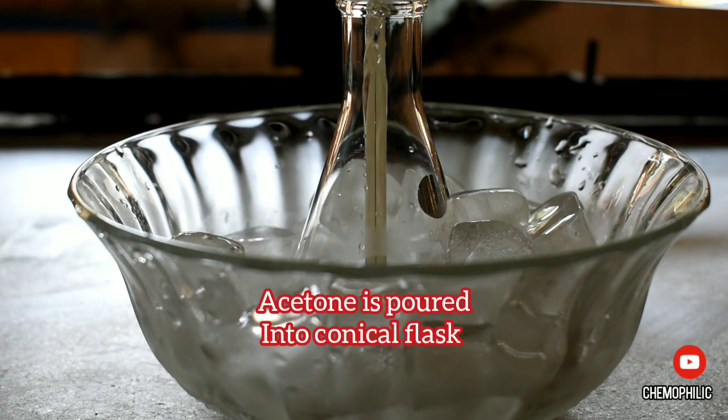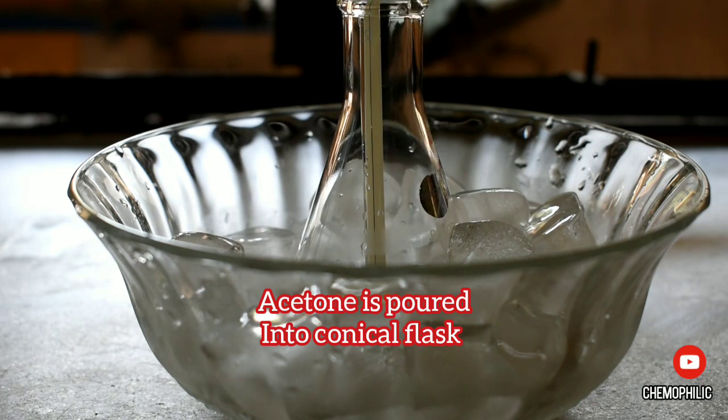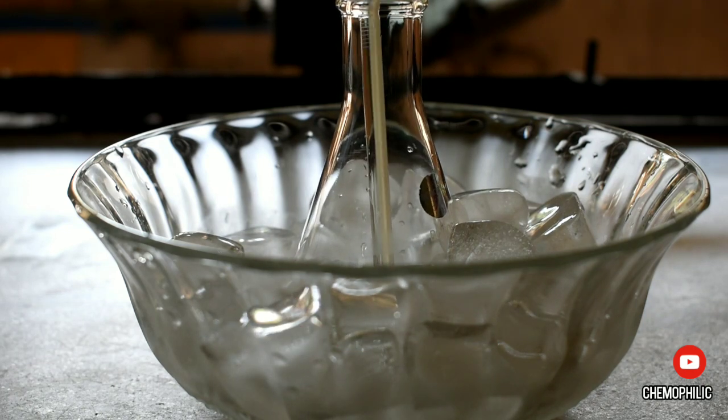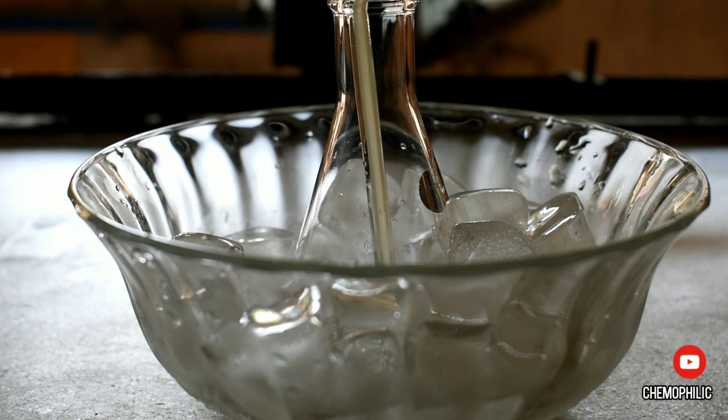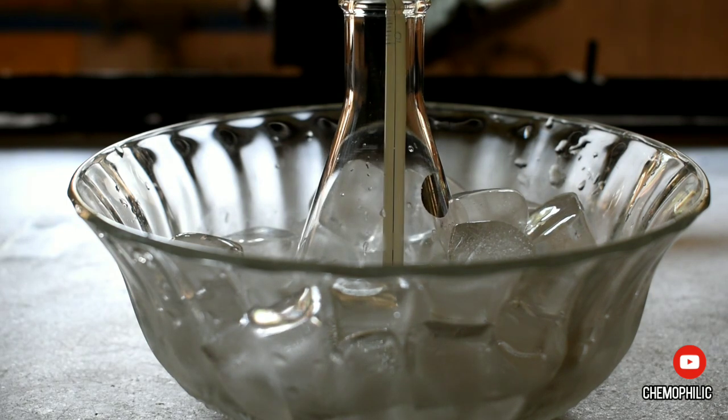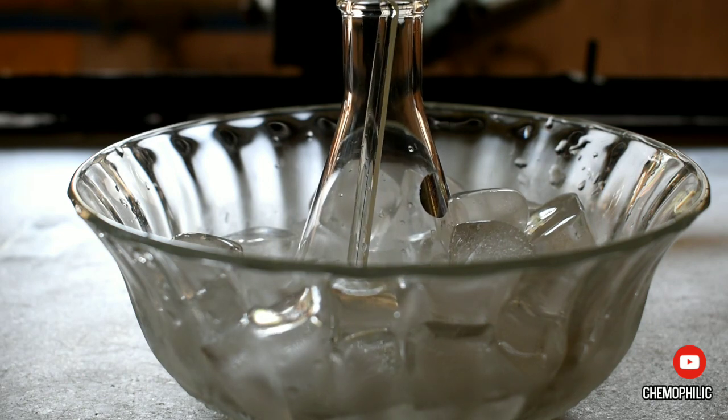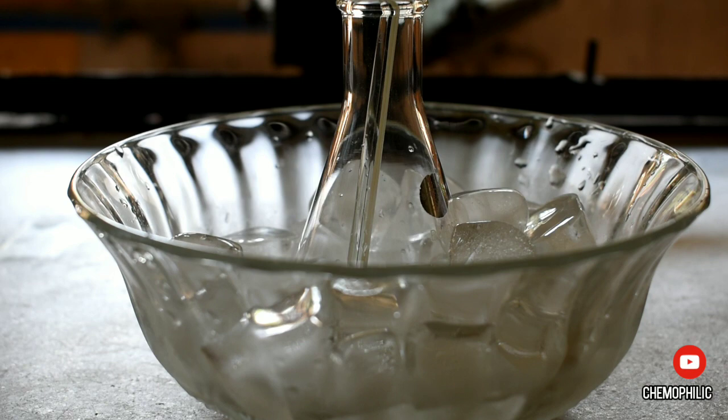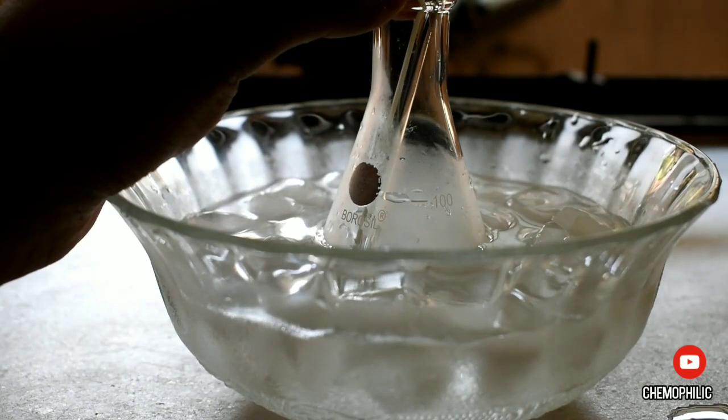Then I poured the acetone into my conical flask and waited for the temperature to fall down around 5 degrees Celsius. I waited for five minutes while the temperature fell down to 4 degrees Celsius.